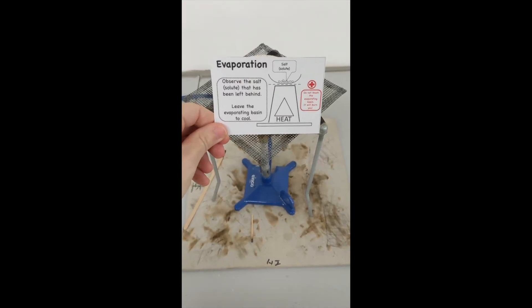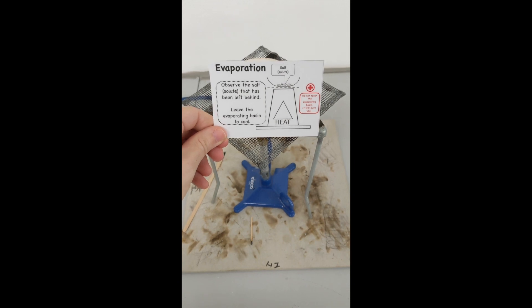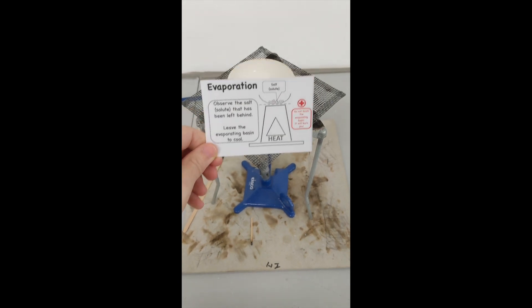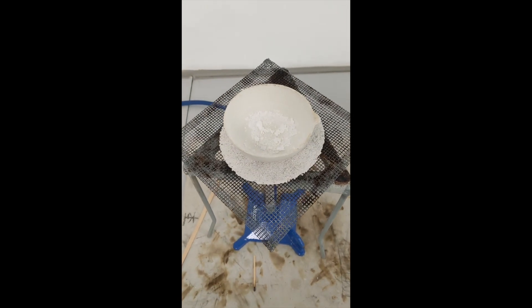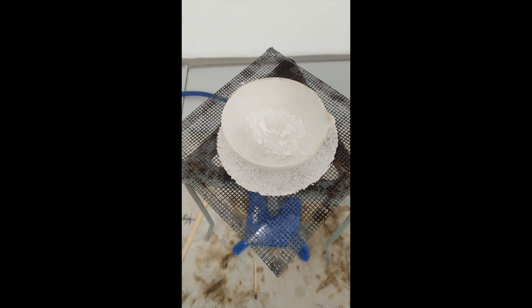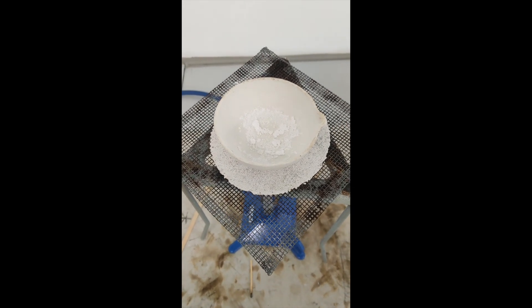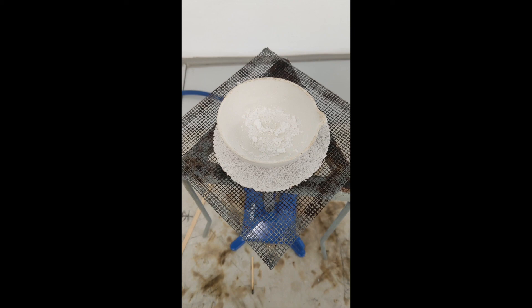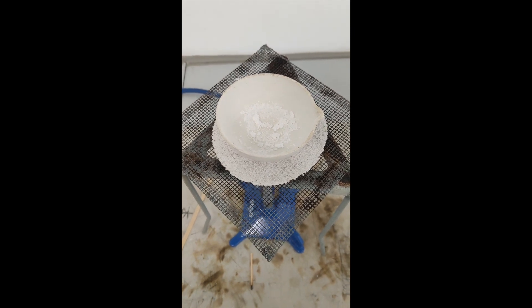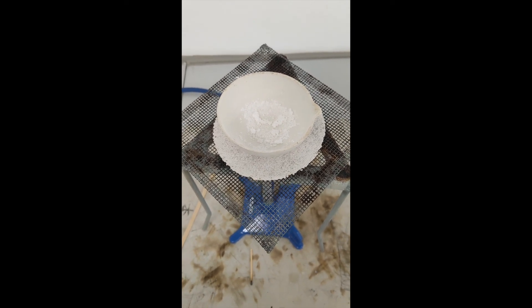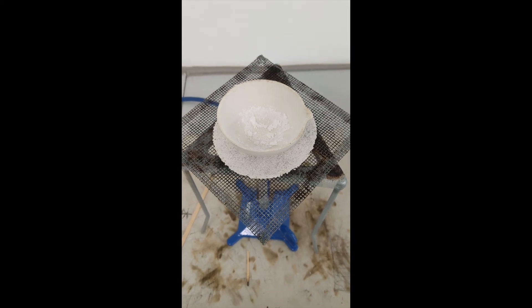So once all the evaporation of all the water has happened, the salt doesn't evaporate and we're left behind with pure salt. There you go, you can see it in the evaporating basin. We're still not going to touch it though, because it's still very hot. Pure salt.